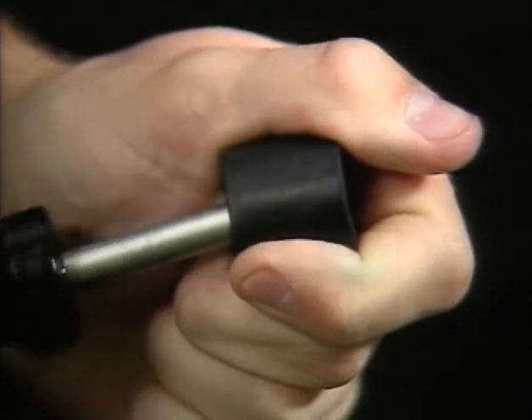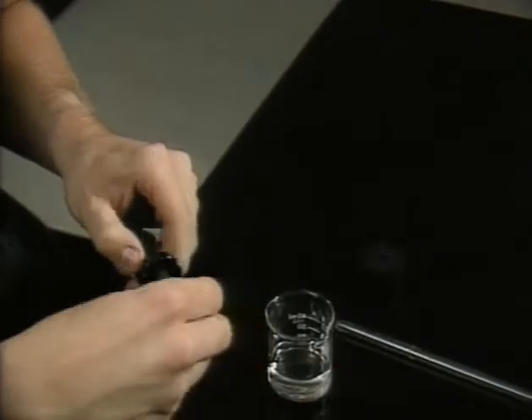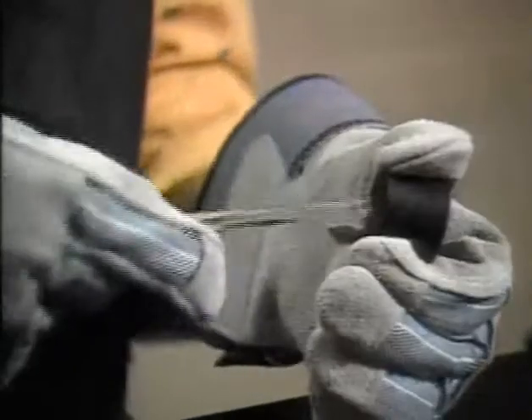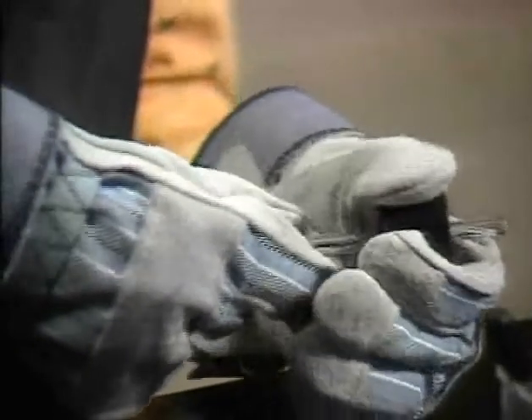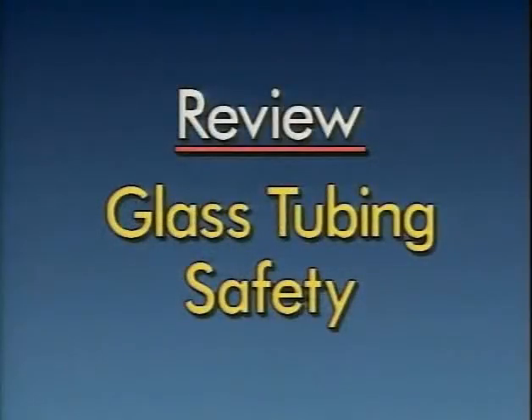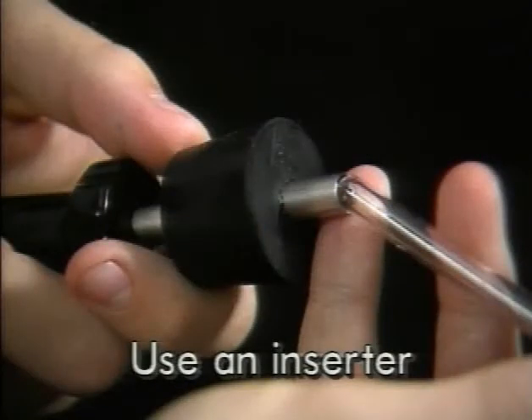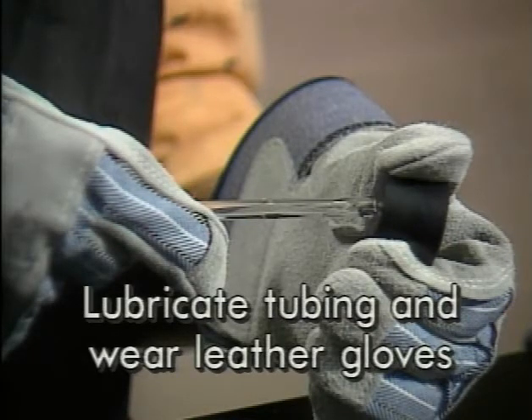To remove the tubing, take out the tip, lubricate the end of the hollow shaft, and push it through the stopper hole around the tubing. Then slide the tubing out through the shaft and remove the inserter. Remember to wash the lubricant off before returning the stopper and tubing to storage. If you don't have an inserter, lubricate the tubing instead and protect your hands with leather gloves — push the tubing gently through, rotating if there's any resistance, and use the same care when removing it.